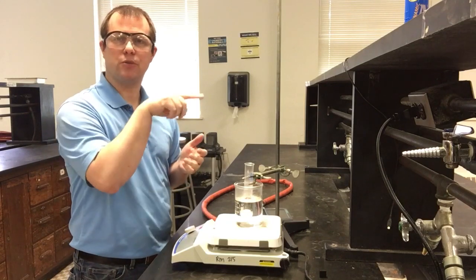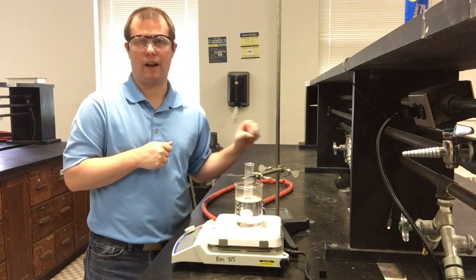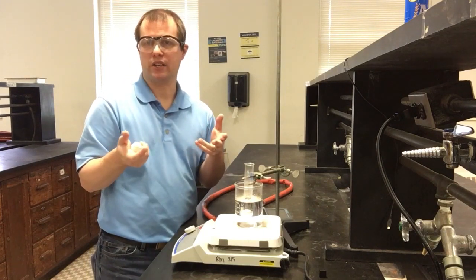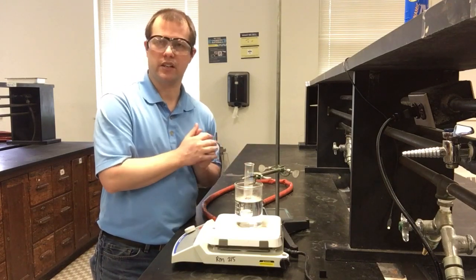But when we see that temperature plateau or that spike, that's when we should notice our solution almost entirely going solid. Or at least the solution particularly around the thermocouple that we'll have down in our sample should be going solid at that particular temperature. That'll be our freezing point. That's really the only goal of this first part: figuring out the freezing point of pure naphthalene for our setup and the things that we're using.